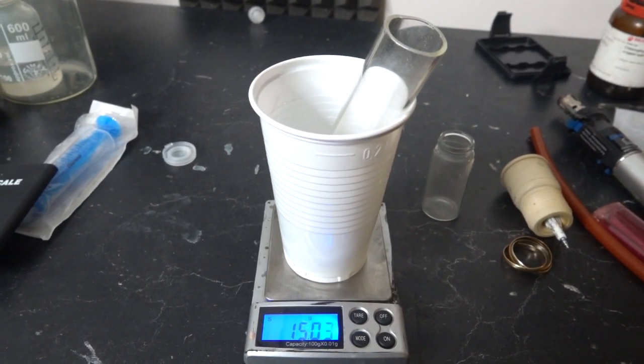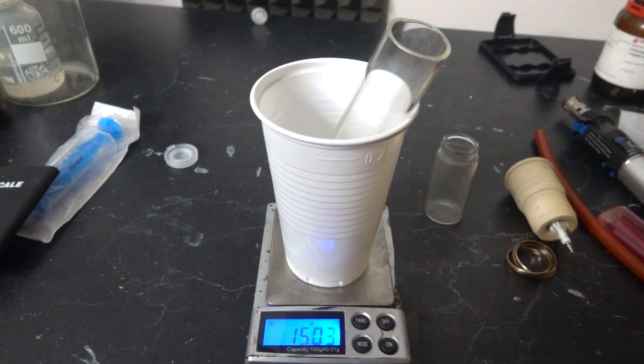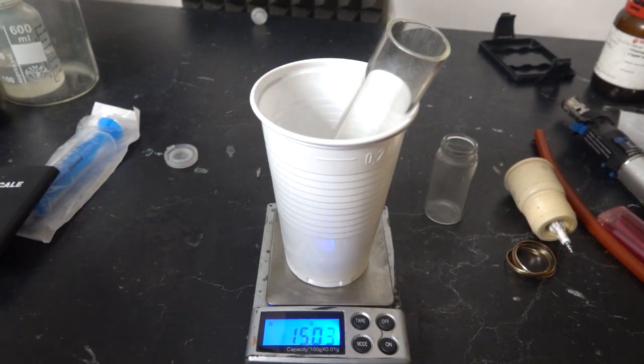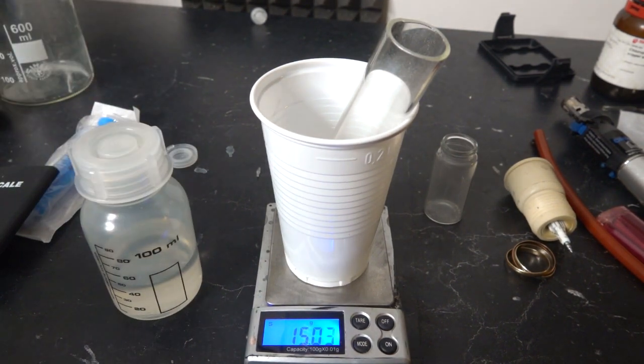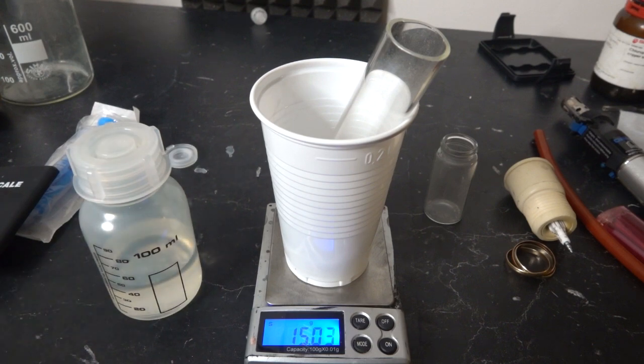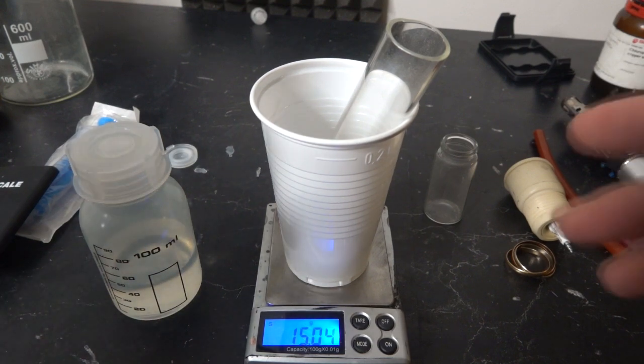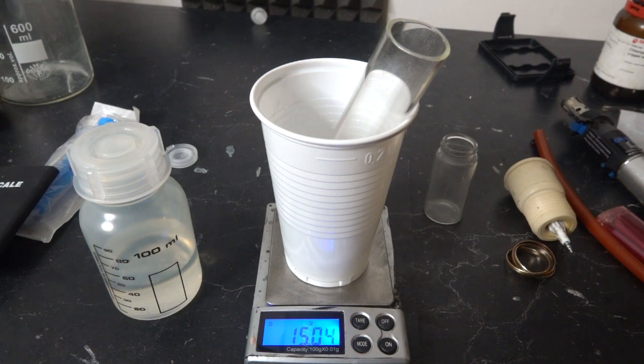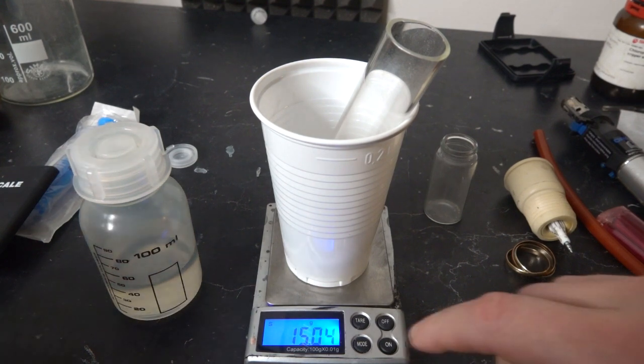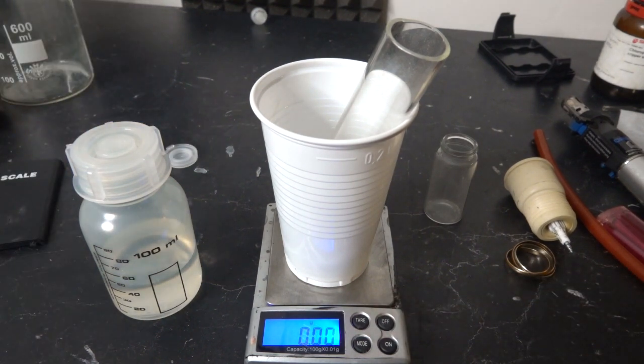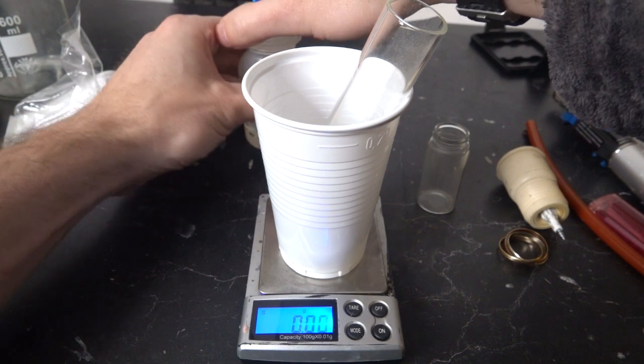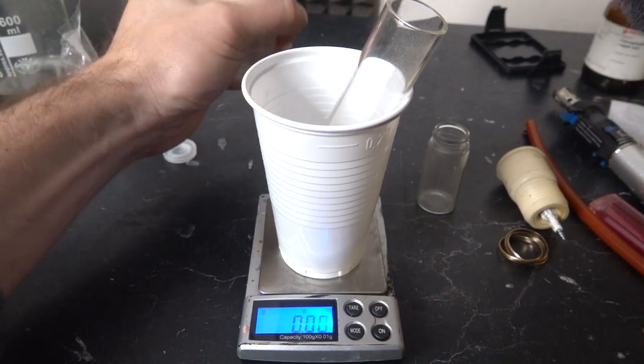So next we're gonna need some nitric acid. Now nitric acid is one of those acids that I absolutely thoroughly respect. I think hydrochloric acid, I'll stick my fingers in, I don't care that much. You wash it off, it's no real problem. Sulfuric, that's the same. Nitric, I have a very healthy respect for. If you get this on you, it stings like you wouldn't believe.